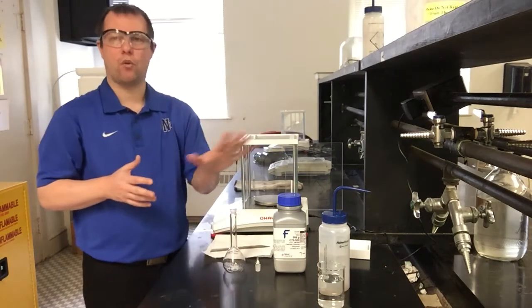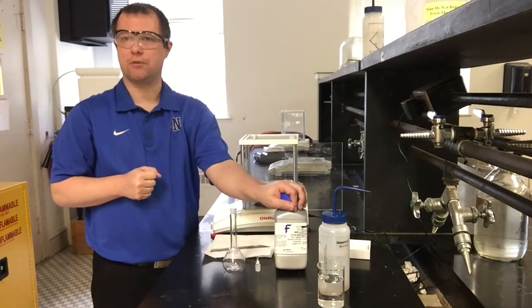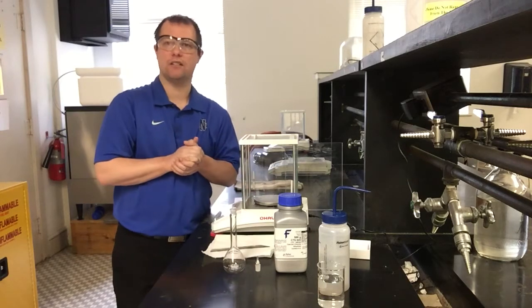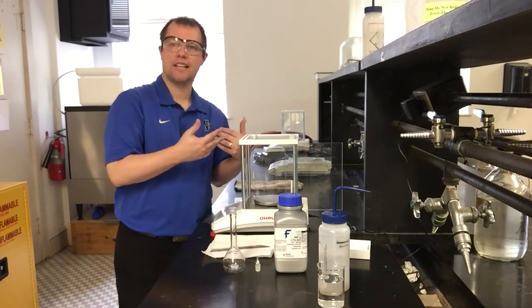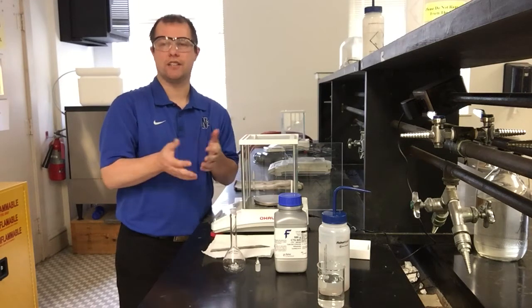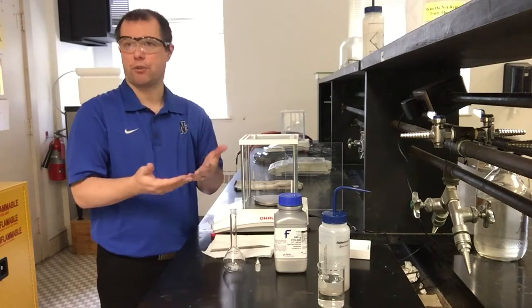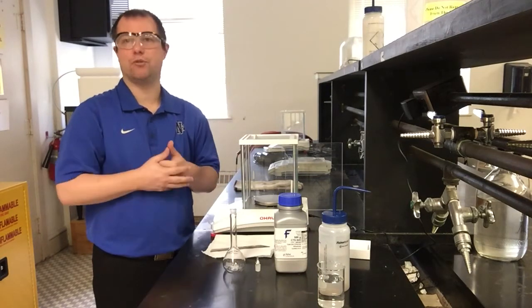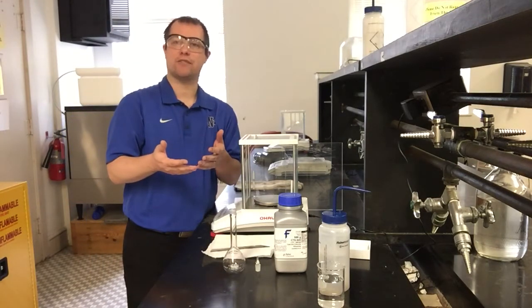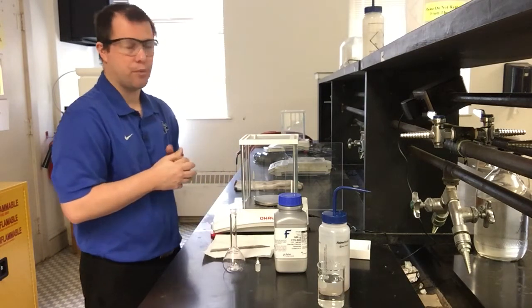The first way, that we'll be doing a full walkthrough of in just a second, is going to be using a solid. So we have calcium chloride dihydrate, which is one of our reactants for a precipitation reaction. And we're going to be massing out an exact amount of solid to be able to make our solution. And then in the second part, we're going to be making a solution by doing a dilution on sodium carbonate to get it to a proper concentration for the precipitation reaction itself, which is what we'll do then in the third part of our experiment: mix the two reactants, isolate our precipitate through a filtration, and then we can get a final mass of our product so that we can actually do some stoichiometry and percent yield calculations at the end for our post-lab assignment.